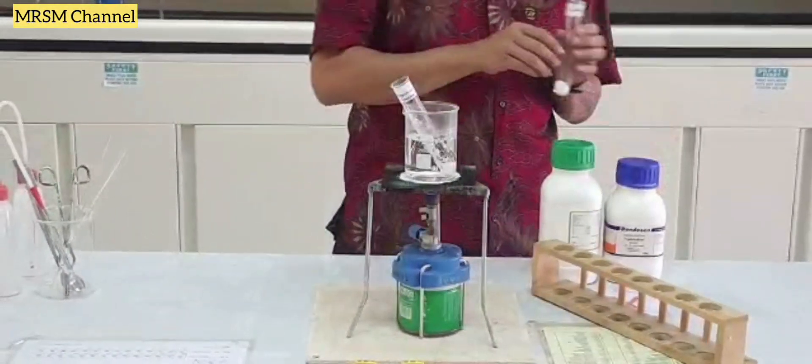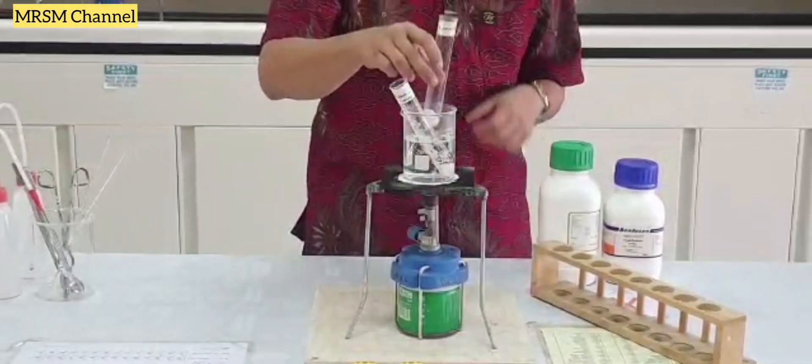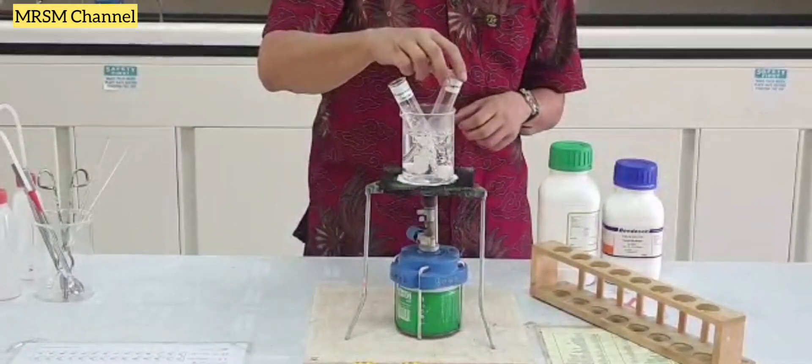Make sure to close the lid and then put it into the boiling water.